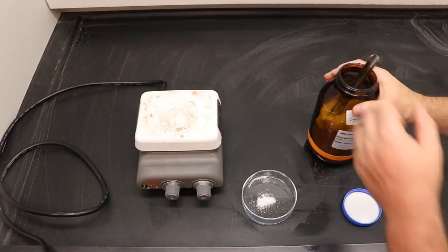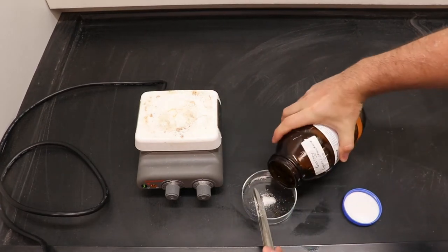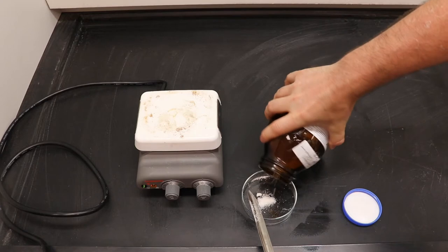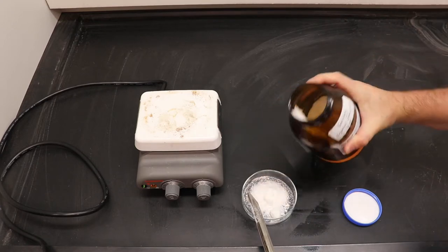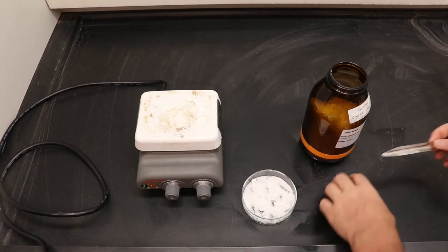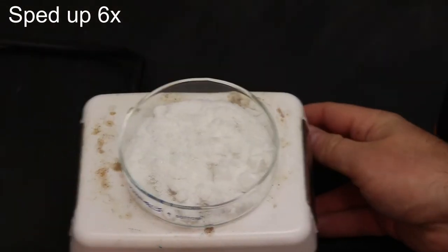All right, here's my setup under the fume hood.